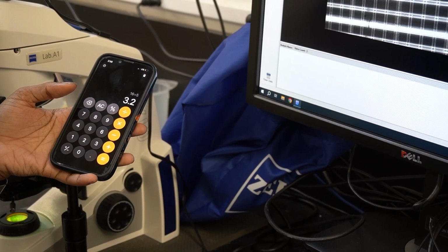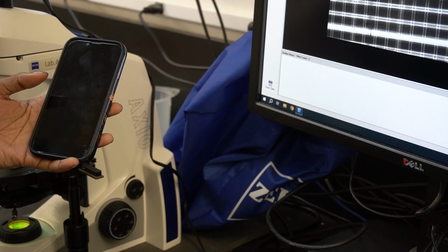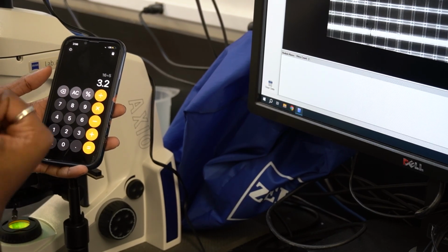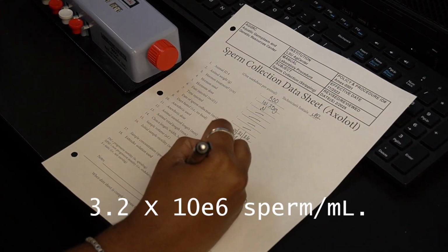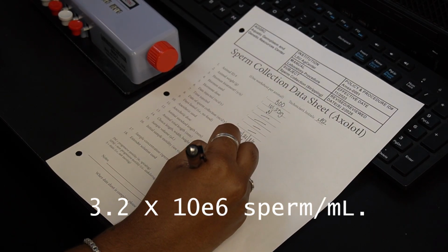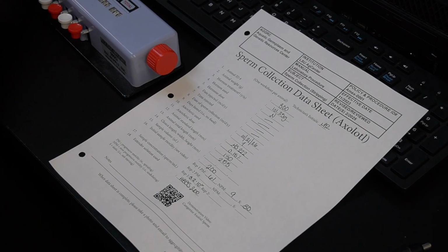And then what we'll do from there is we will multiply it by 100 since we have to count our dilution factor in. So instead of just 3.2 for this concentration, we have 3.2 times 10 to the 6th.